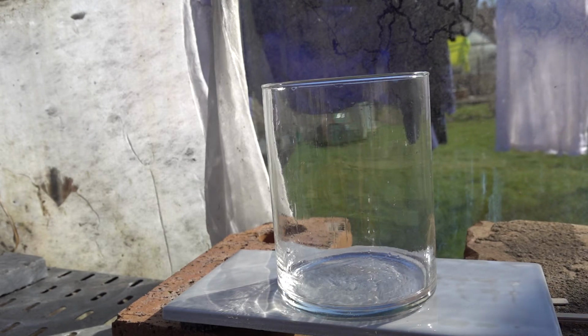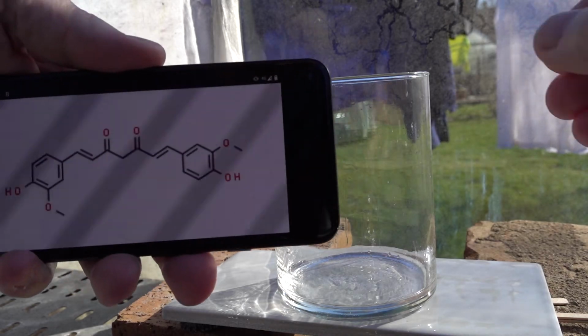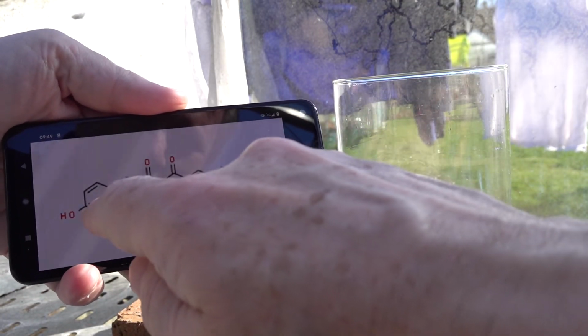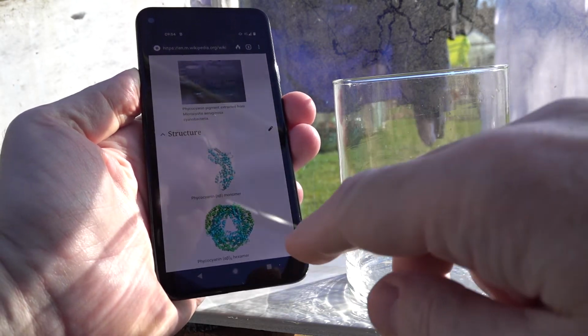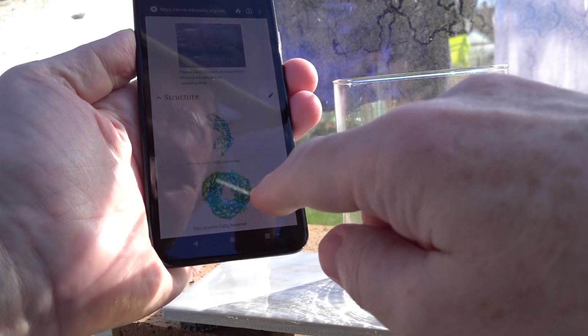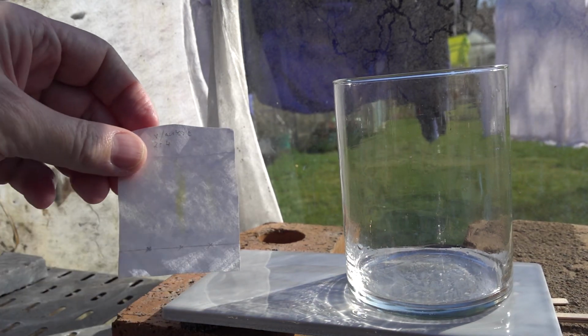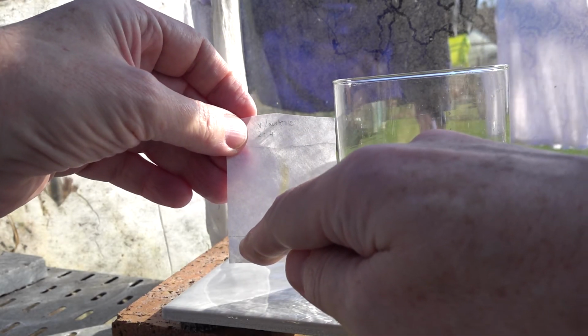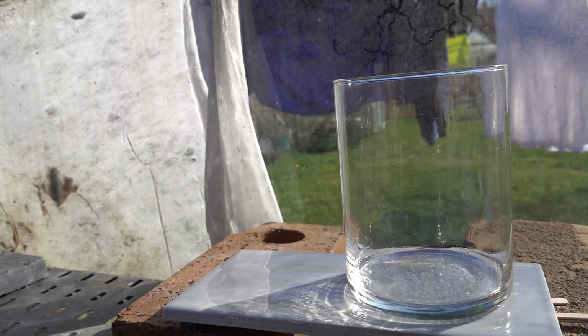So if we were to look at the structures of the materials, we would see that curcumin here, the yellow one, contains these double, single, double, single, double, single, double bonds, a conjugated system. Our structure of the phycocyanins here on Wikipedia is a complex protein-like structure, and there's no way we can carry out paper chromatography on a material like that. So our chromatogram, with the blue colour rapidly disappearing down here for the spirulina, was never going to work, and that illustrates the problem with thinking you can carry out chromatography on something which is quite a difficult mixture.